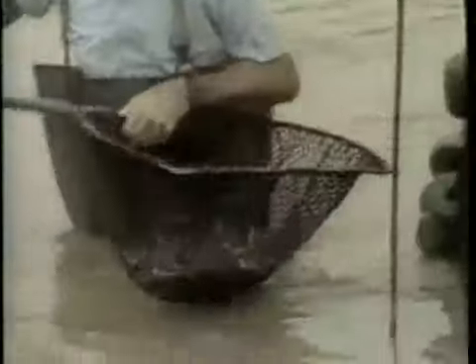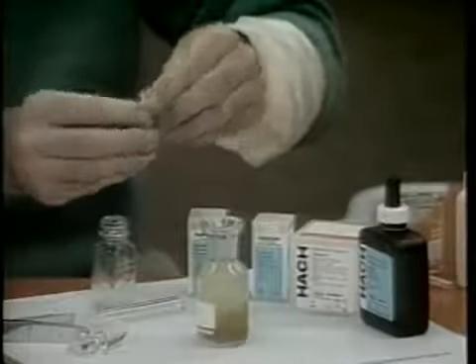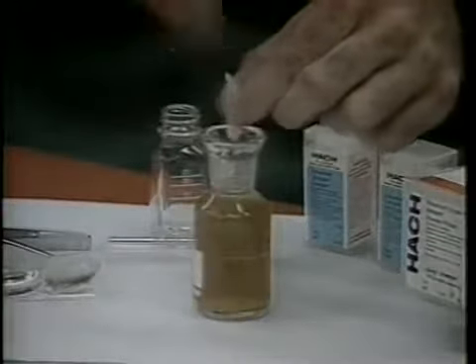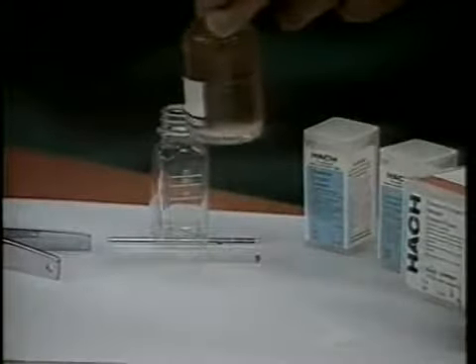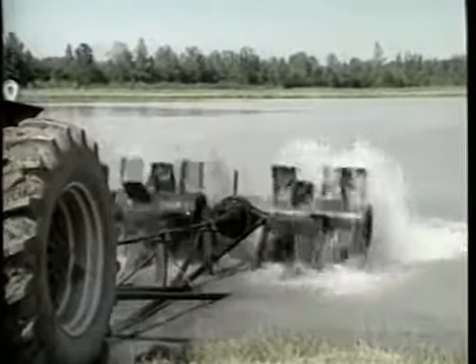As mentioned throughout this video series, successful fish production is dependent on the quality of water present. Tapes 1 and 2 of this series have introduced important water quality parameters and their influence on the biology and chemistry of a typical fish pond. However, in order to properly manage the water quality of a pond, methods of measurement of the various parameters must be understood. Therefore, the purpose of this tape is to describe the testing procedures for the water quality parameters which were discussed in tape 2. Corrective measures for each parameter, if found to be at levels adverse to good fish production, will also be discussed.